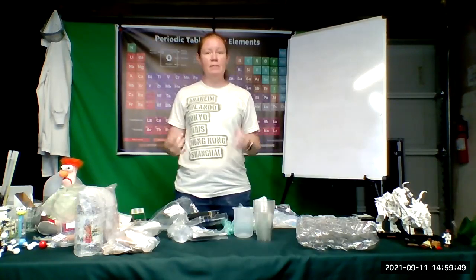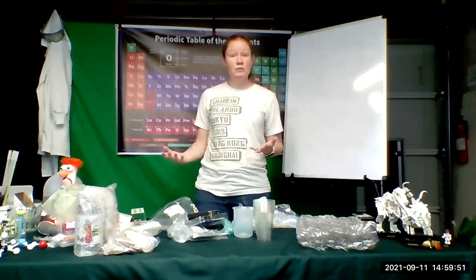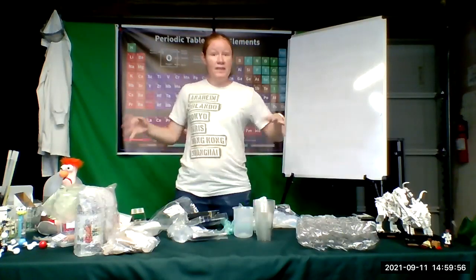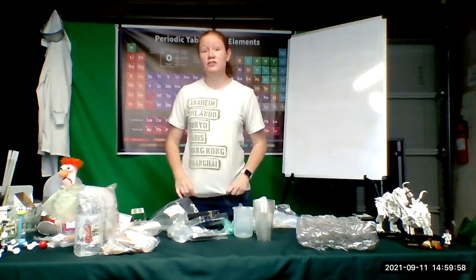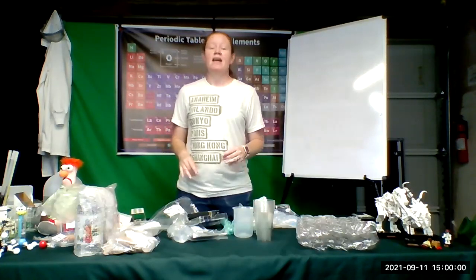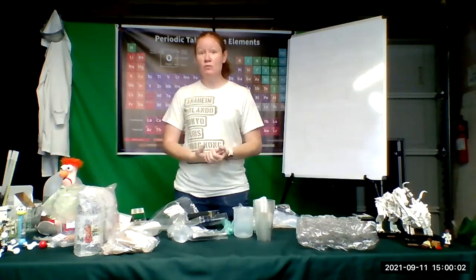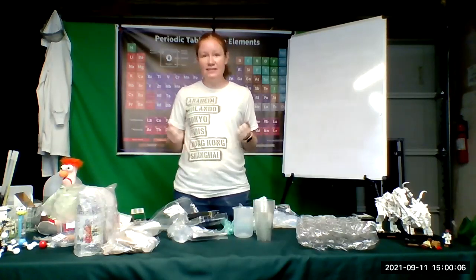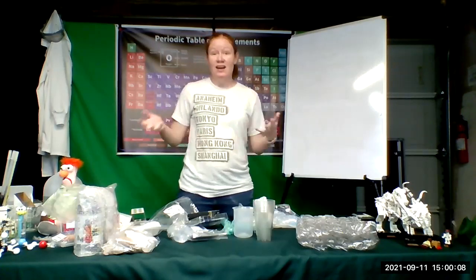As you're prepping your pre-lab, you will see all of the equipment that you will need in order to successfully complete that experiment. So anyway, hopefully this helps you understand what you're receiving in your kit, and hopefully you started receiving them and you're excited to actually go forth and do some chemistry at your house.